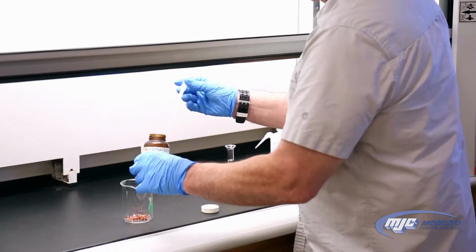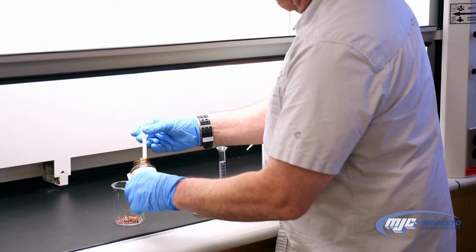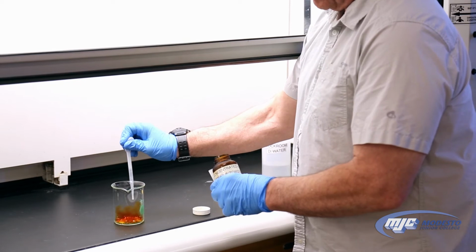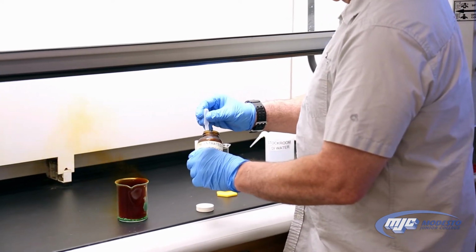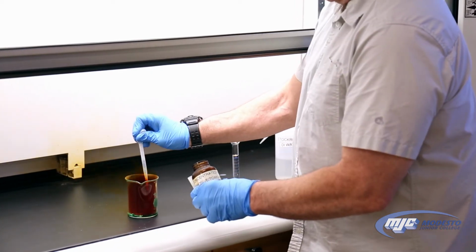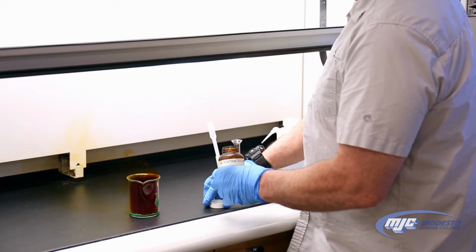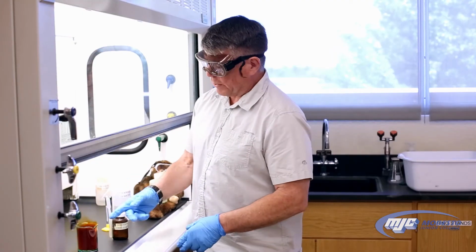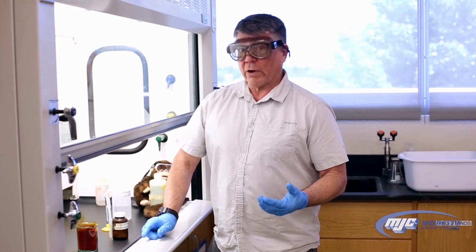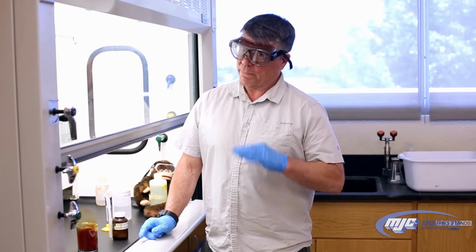So what I do is pull it up about 3 mLs, and it starts reacting right away. That's the nitrogen dioxide that you can see. Nasty, nasty stuff. You want to make sure you do not breathe any of that in. If you breathe that in, the nitrogen dioxide reacts with the water in your lungs and makes nitric acid in your lungs. Not good.